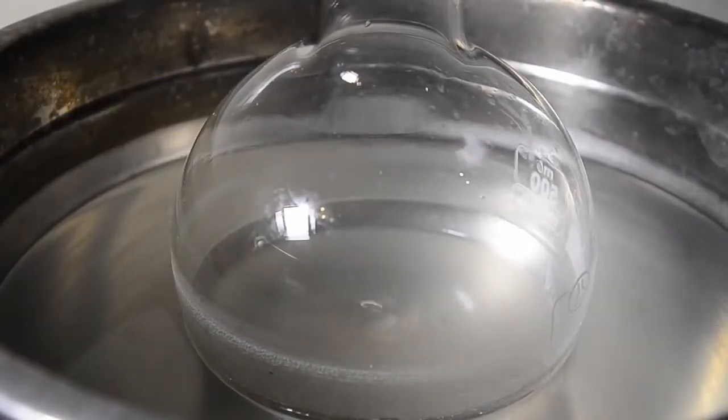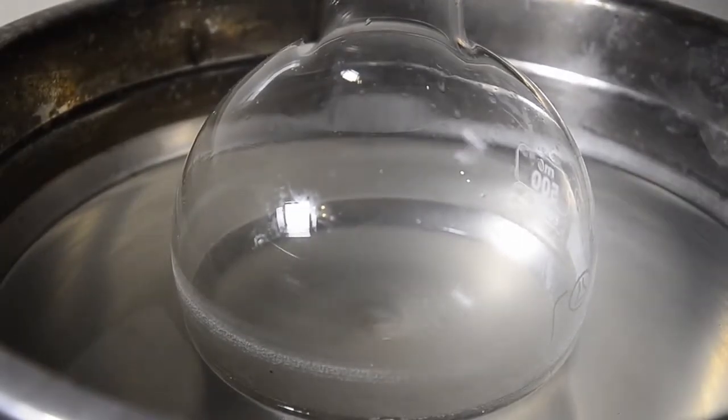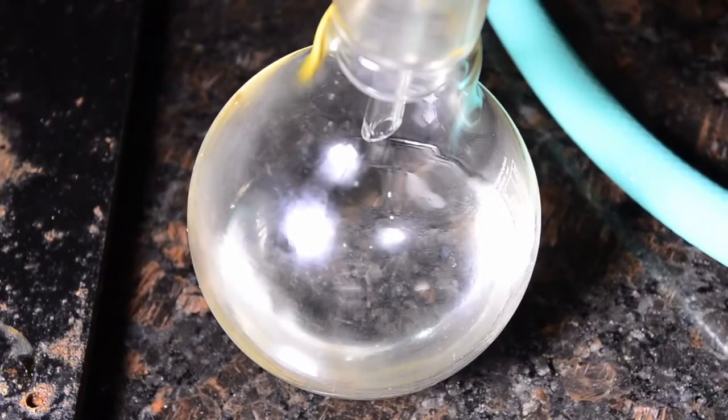At the end of the distillation there is only a syrupy viscous layer remaining in the flask and a perfectly clear distillate.